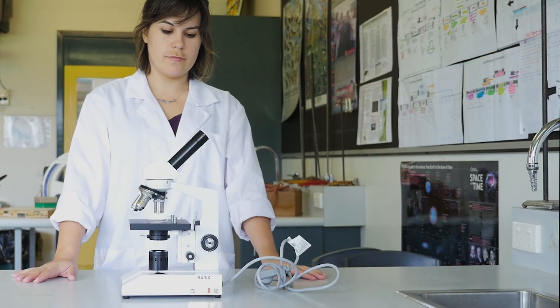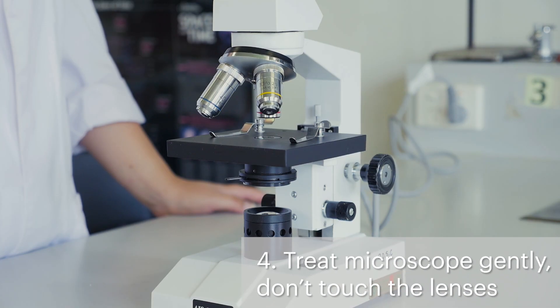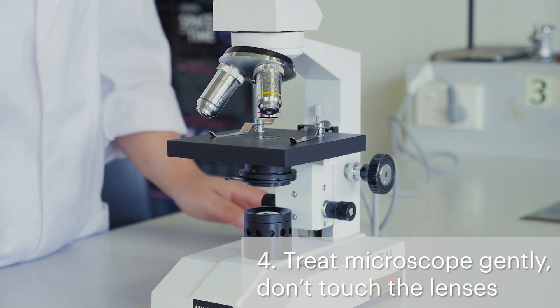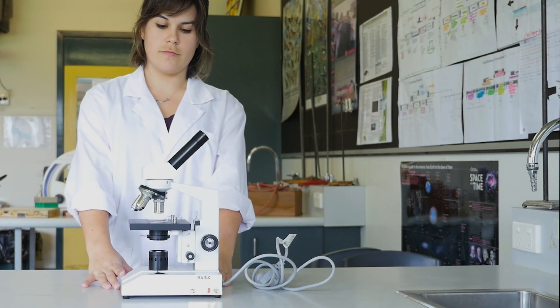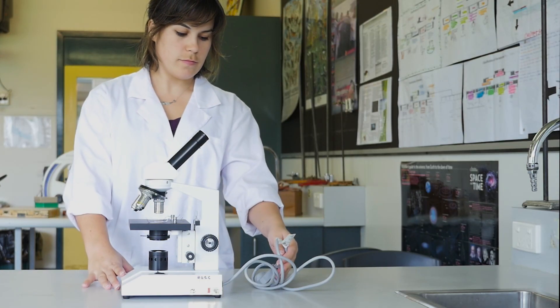Be careful not to bang or drop the microscope. This can damage the microscope, particularly the lenses. Avoid touching the lenses because this will make them dirty and it will make your images blurry. If you think the lenses need cleaning, ask your teacher to show you how.